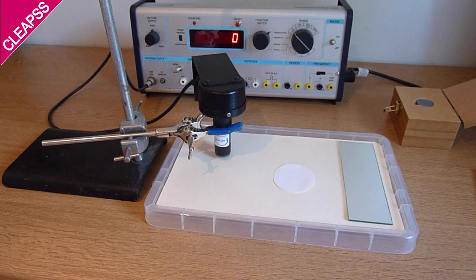Remove the GM tube cap. Carefully clamp the GM tube so the window is about 2mm above the plastic tray. Clamp the tube, not the tube holder, otherwise there is a risk the tube could fall out of the holder and become damaged.